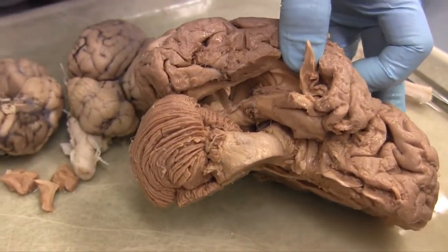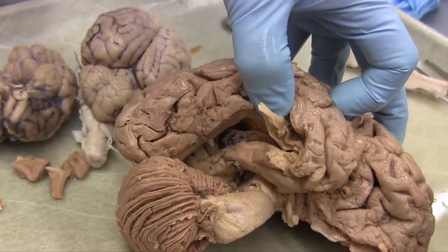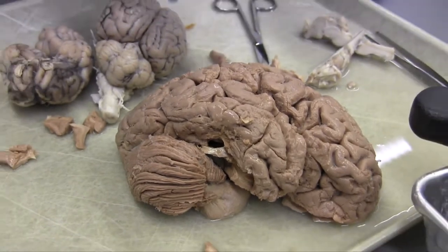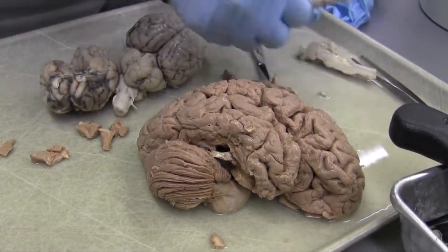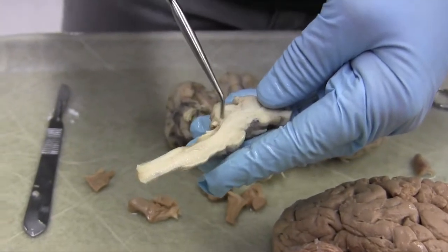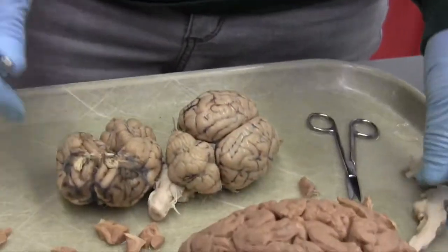And all along the way, there's this stuff, this choroid plexus. It's being churned out of the lateral ventricles. It also gets produced in the third ventricle. It also gets produced in the fourth ventricle. It does not get produced in the very vulnerable cerebral aqueduct. You wouldn't want to put choroid plexus here because it would possibly clog this up, and then everyone would have hydrocephalus. So we don't want that.